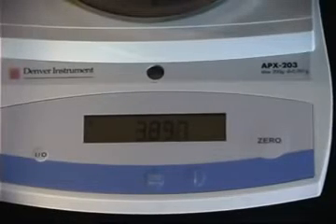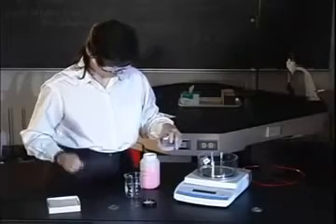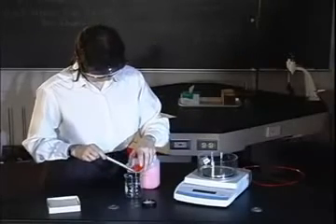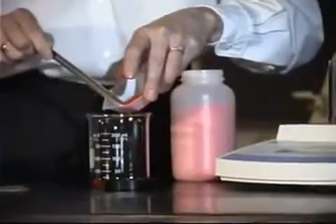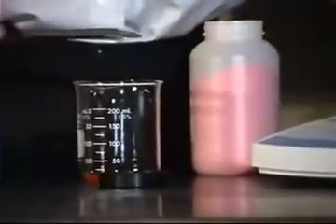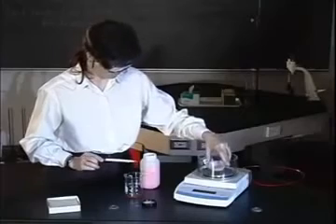If you transfer too much material to the weighing tray, do not return the material to the original container. You may use a spatula to remove the excess material and place it in a waste container. You must always remember that many groups of students will use the same stock chemicals. Contamination in one lab by one student can result in erroneous results for as many as a hundred students.